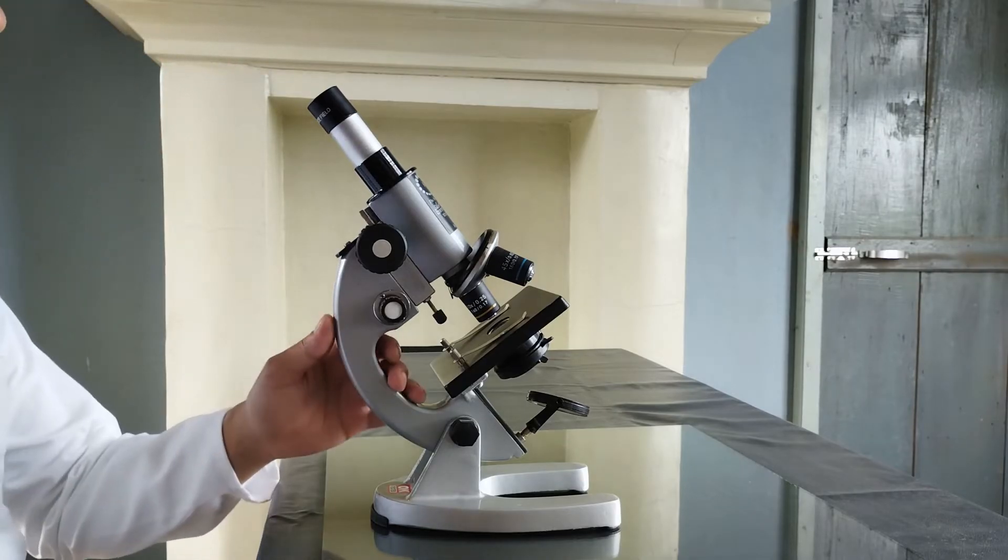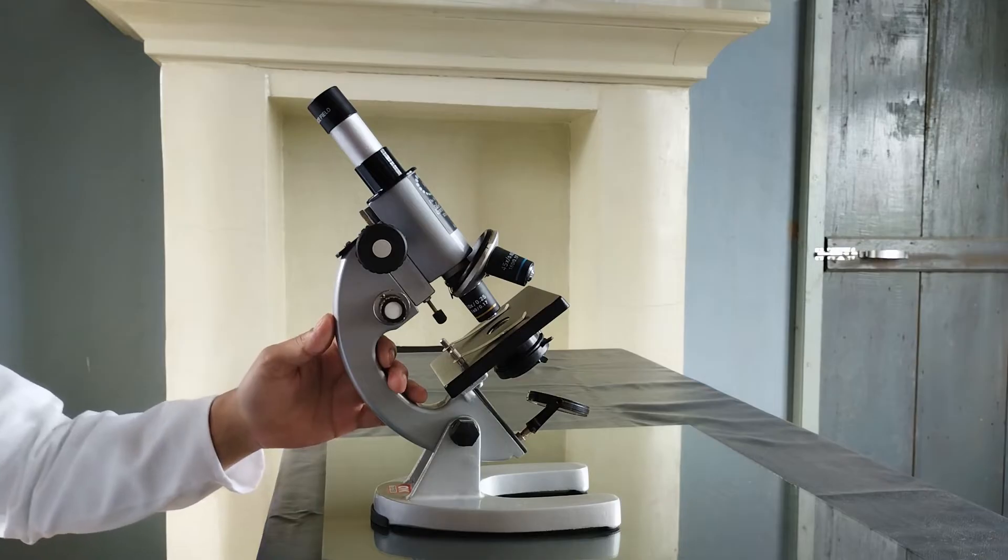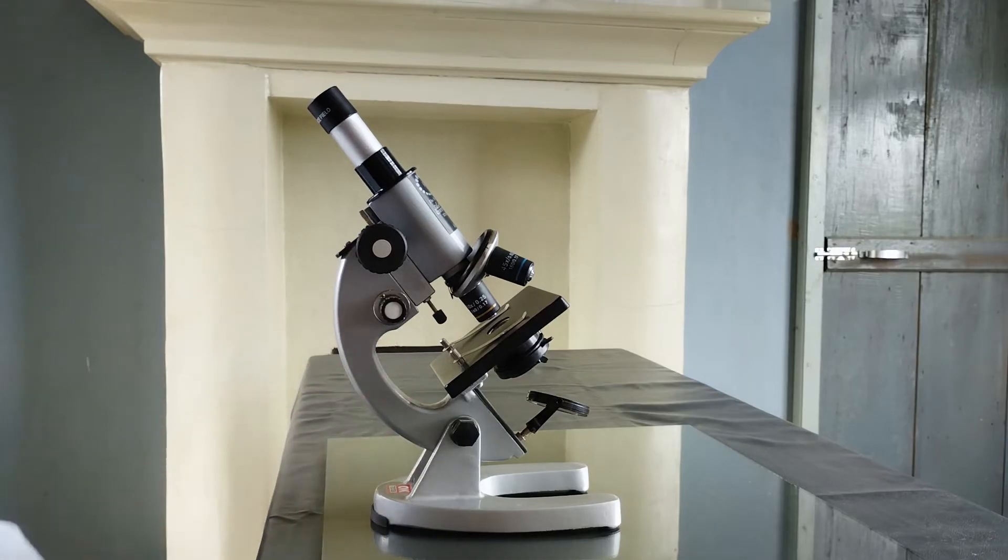The microscope can be conveniently used in this inclined position if the specimen is going to be a dry permanent slide preparation. However, for temporary slide preparations where the specimen is mounted in a liquid base, the microscope needs to be kept in an upright position or at least with minimal inclination to avoid the specimen and the cover glass slipping off from the slide during examination.